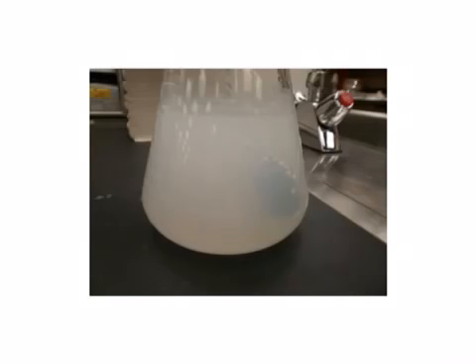So the calcium carbonate that is formed is solid. These small solid particles get suspended in the mixture, and that gives you the impression of a cloudy or opaque mixture. And as more calcium carbonate is formed, these particles will clump together, coagulate, and then sink to the bottom as a precipitate or deposit on the walls of your vacuum flask.